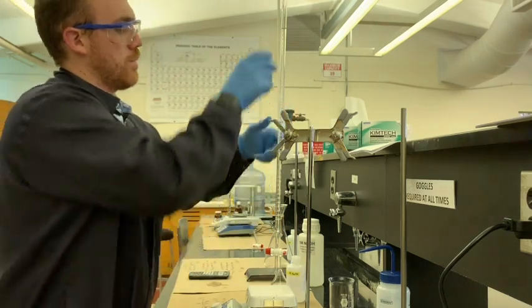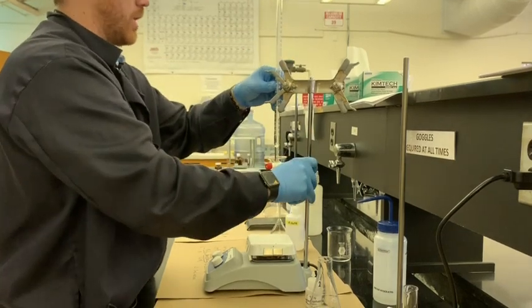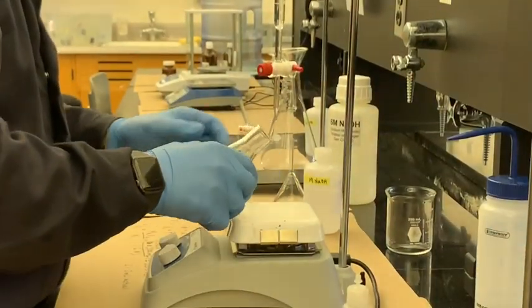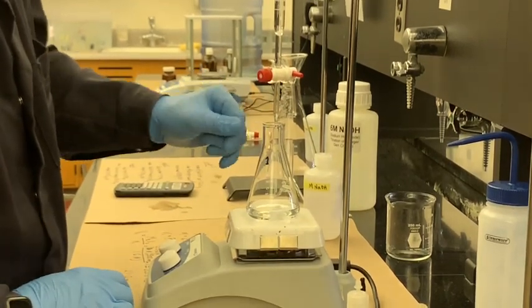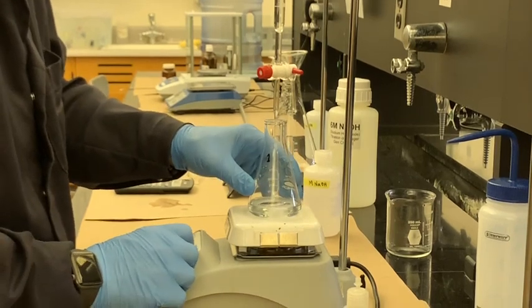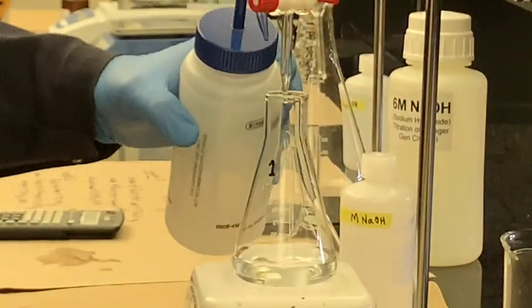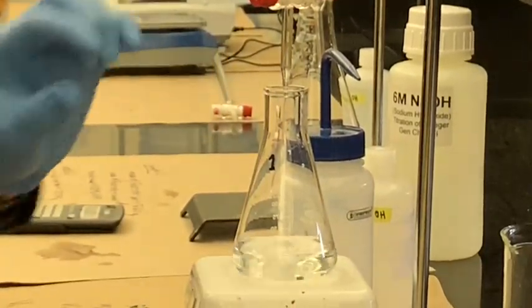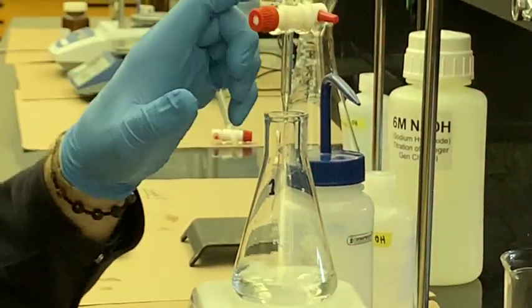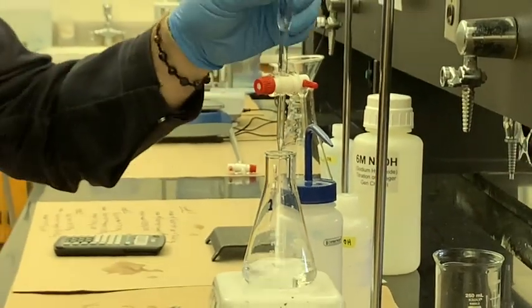We're then going to put your burette in position. Make sure the stir bar is working. You want to keep the tip of the burette just past the lip, just so that you don't have any kind of splashing problems, and far enough away so it's not going to be in the solution. But if you have to wash any of the solution down, it's also not going to get knocked out of the way. It's just a very perfect little spot where you just have to barely dip the Erlenmeyer flask to get it in position. All right, and then we begin.